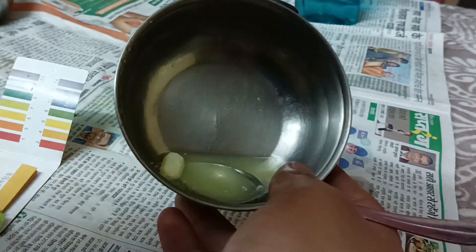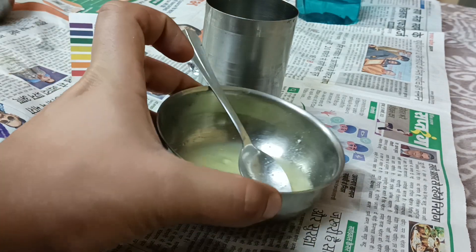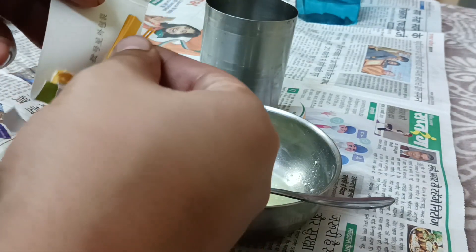I'm going to pause the video while stirring and resume when done. Now I have prepared the solution and stirred it well. I'm just going to pull out one pH paper.